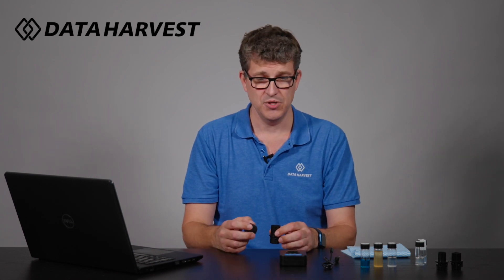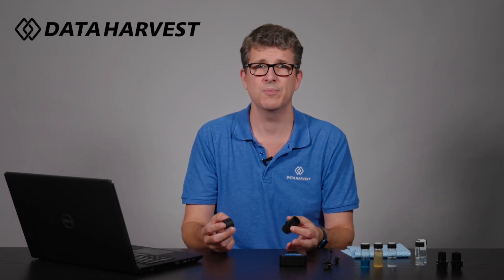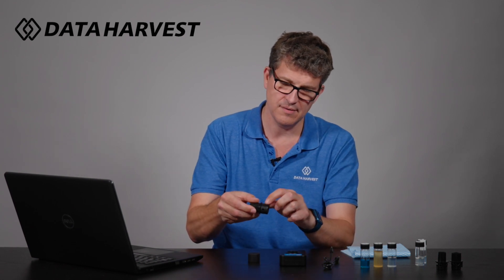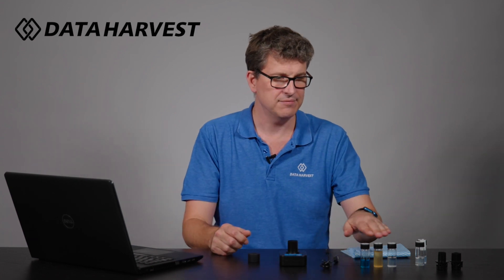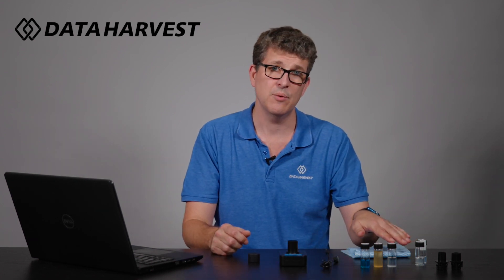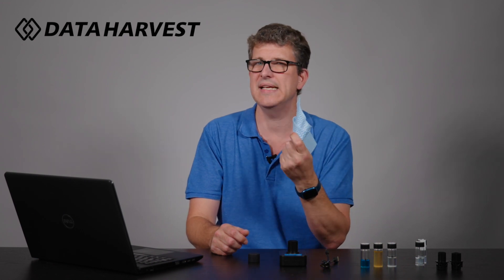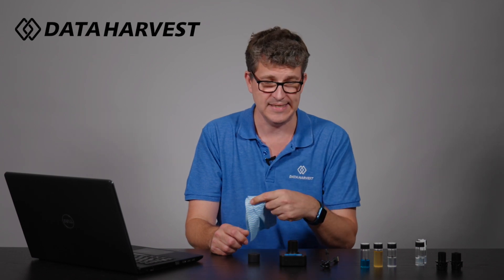All our wireless sensors are Bluetooth and USB so you can connect to all the normal devices — Android, iOS, Chromebook, Apple Mac, and Windows. To pop this in, it'll only go in one way; there's a little edge on there so you can put it in the right way. We have five bottles that come with a standard and a cloth which prevents scratches, and you do really need to wipe the vial each time before you pop it into the adapter.